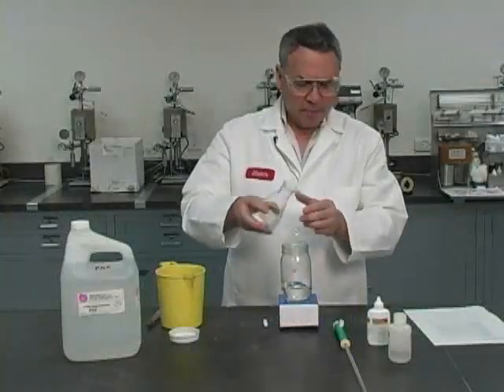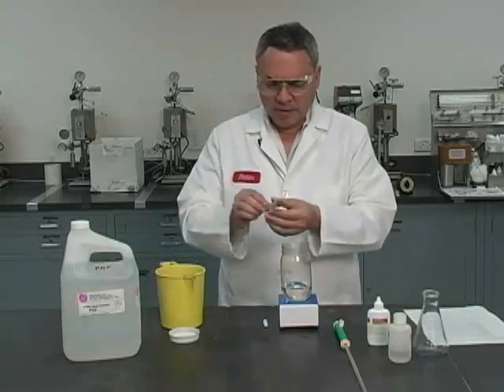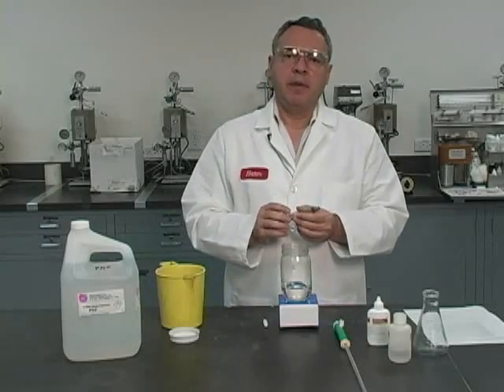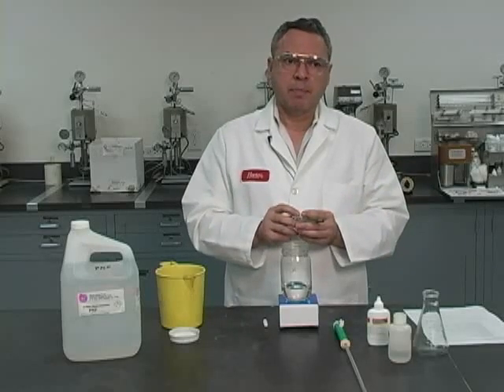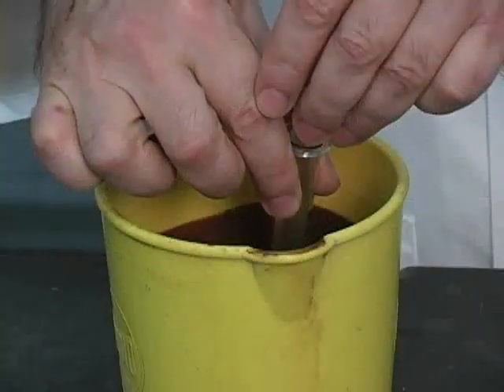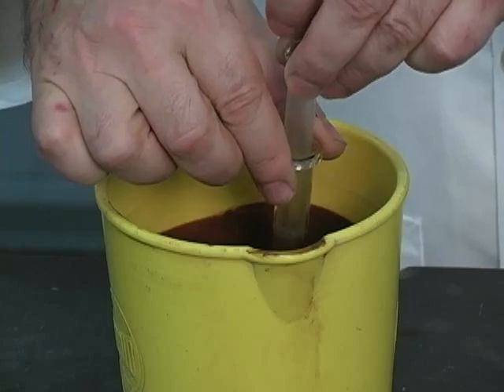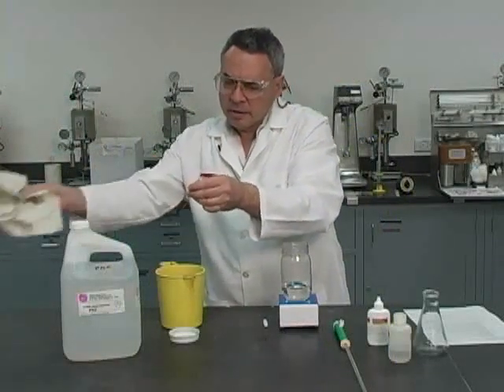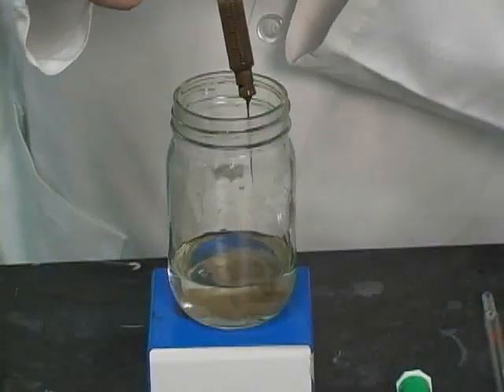And now my next step is to take a sample. So I'm going to be using a 5 cc syringe, and I need 2 cc's. That's required by the API, a standard procedure. Of course, we could go to a larger sample if we need more precision. But in this particular case, I will go, for example, to, let's say, 3 or 4, in this case, 3. Wipe this a bit so I can see the reading. And then go ahead and place. I'm going to push down 2 cc's.